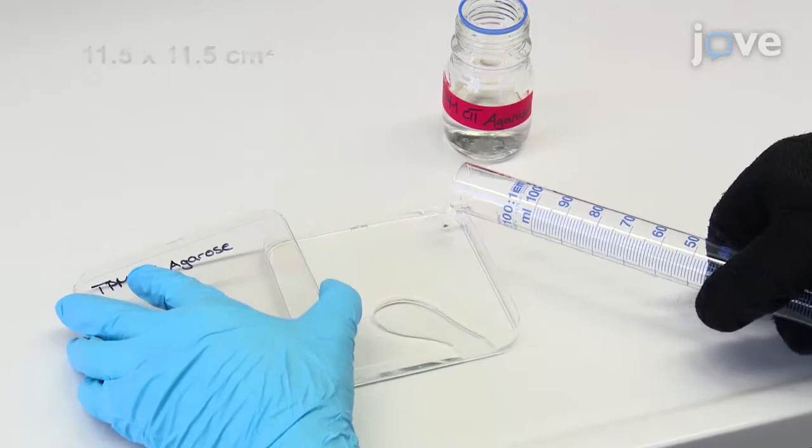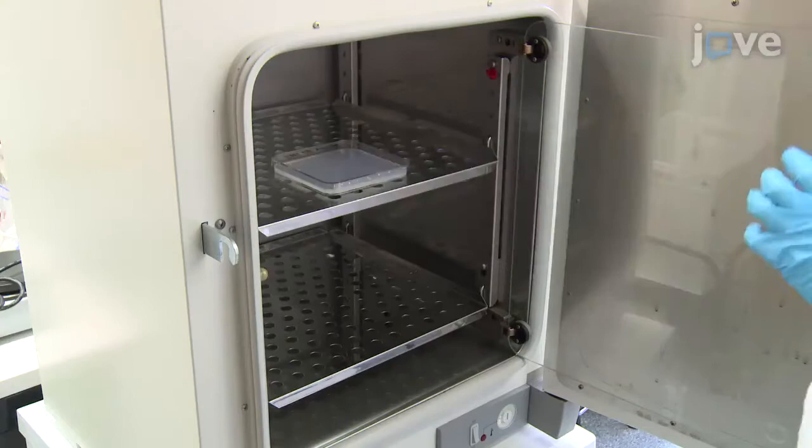Pre-warm the agarose pad at 32 degrees Celsius for at least 15 minutes prior to use.